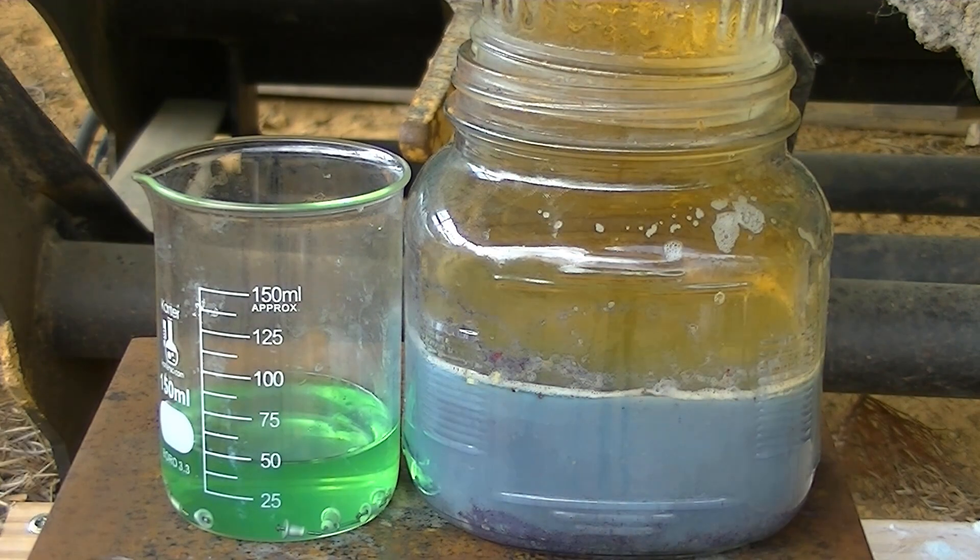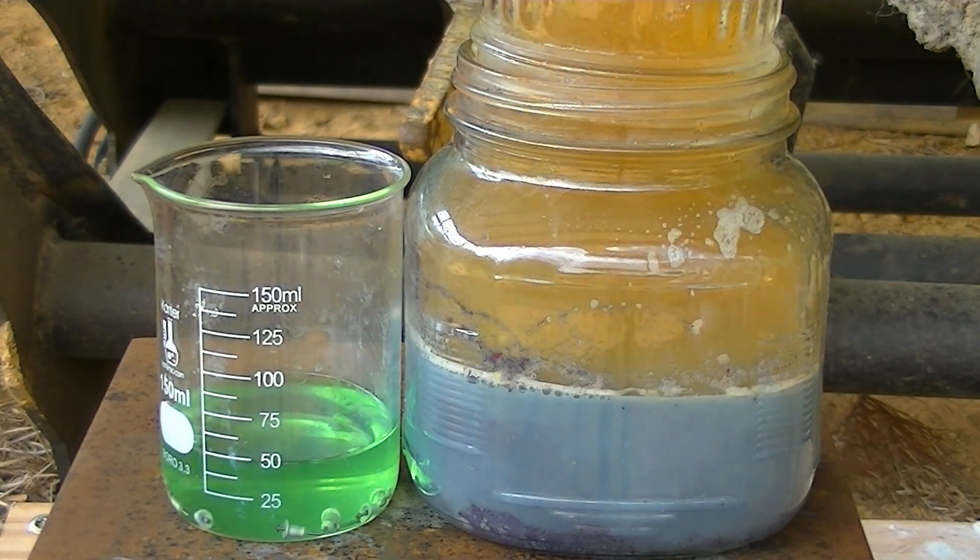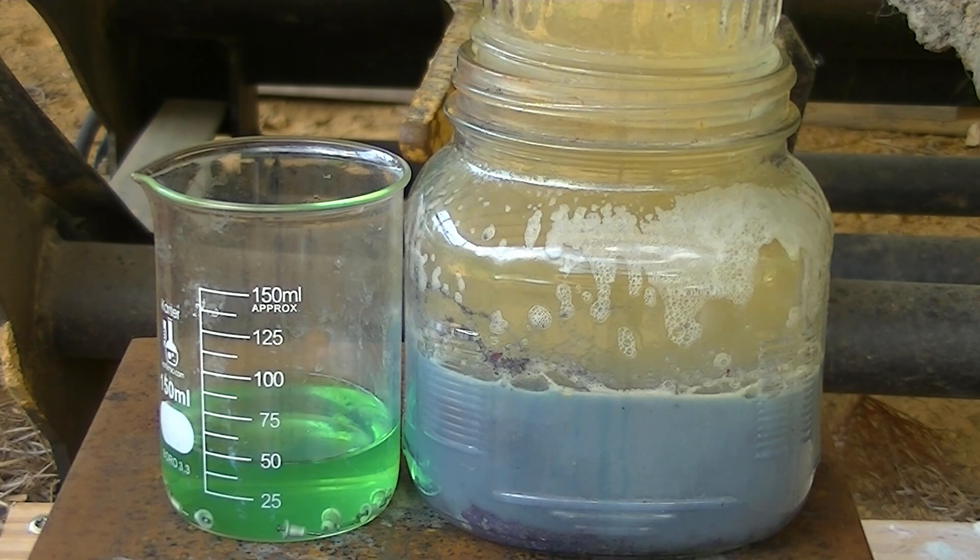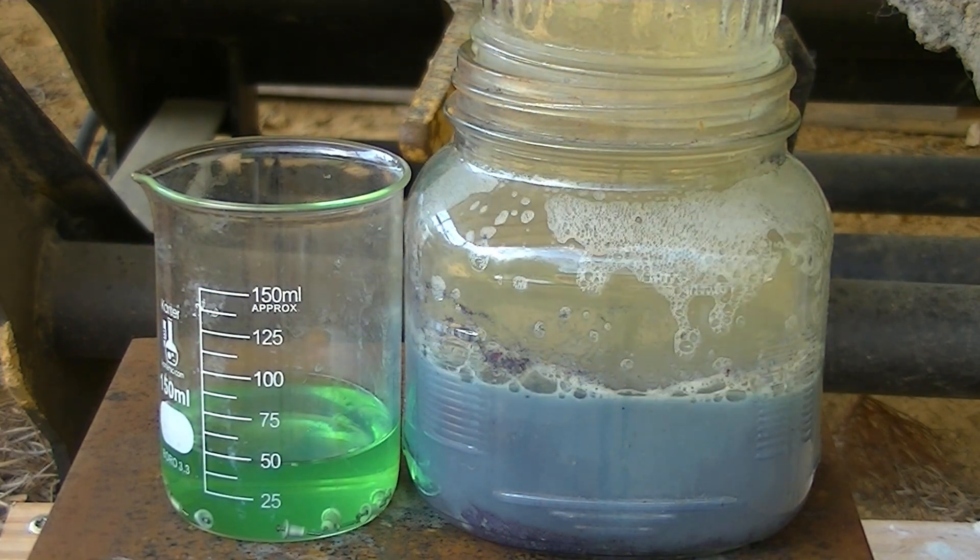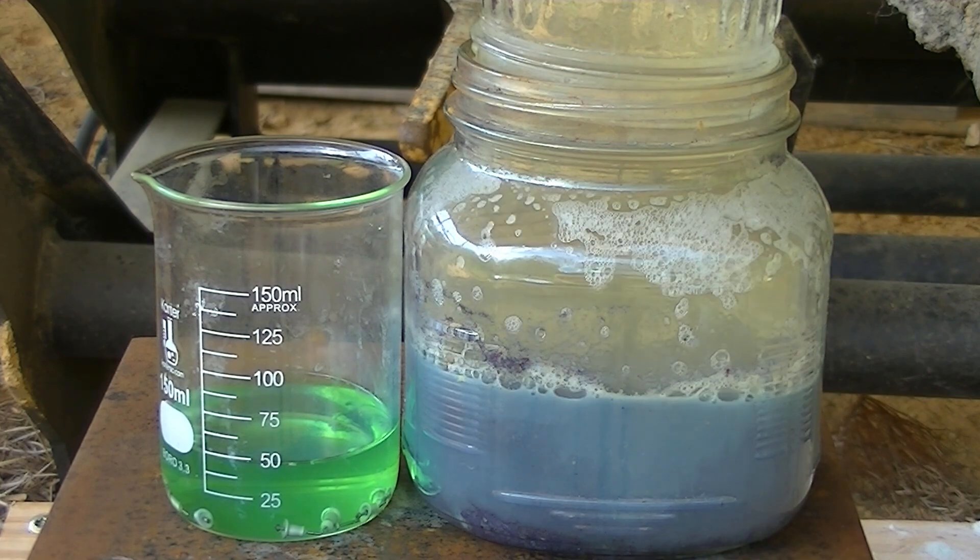That red gas is the nitrogen dioxide. That's the stuff I was talking about earlier that can be very dangerous to breathe. So this whole time I am in an outside setting with a gas mask and I avoid it as much as possible.